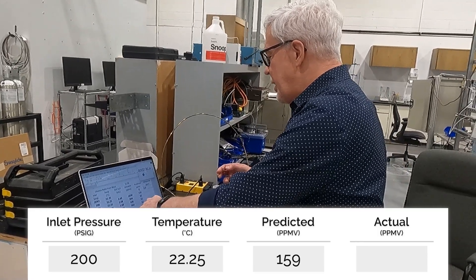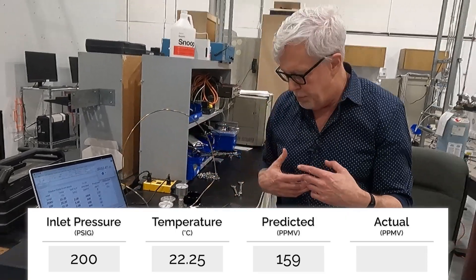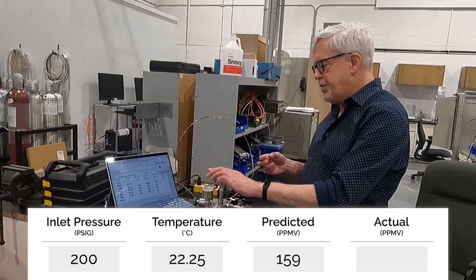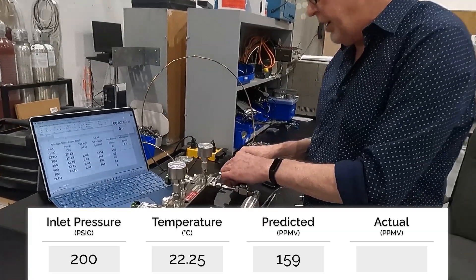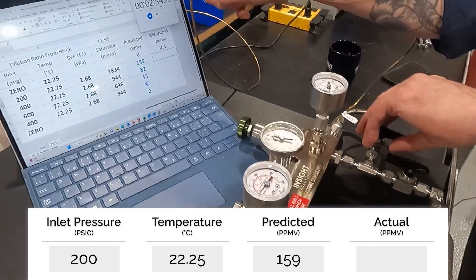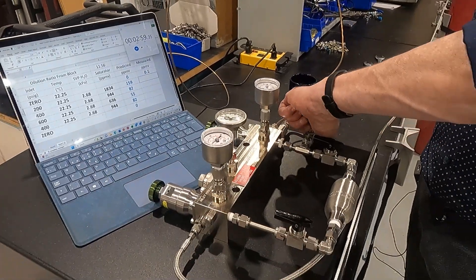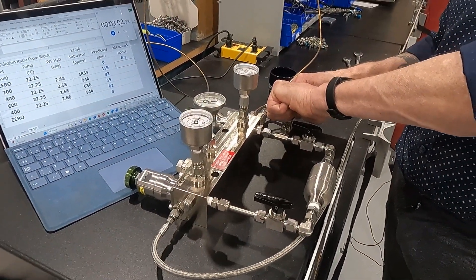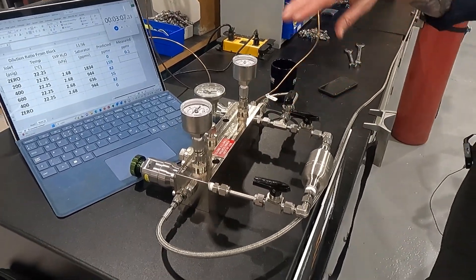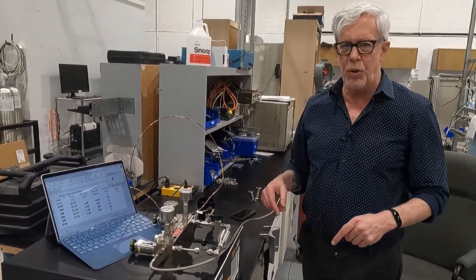The spreadsheet is set up to only show one decimal place, so it'll show it as about 0.1 ppm. Currently at 200 psi and 22 and a quarter degrees C, I'm going to switch in the moisture generation side — you can see this is happening at about three minutes. Just turning the valve, allowing gas to flow now through the moisture generator and mix with the dry gas going in.